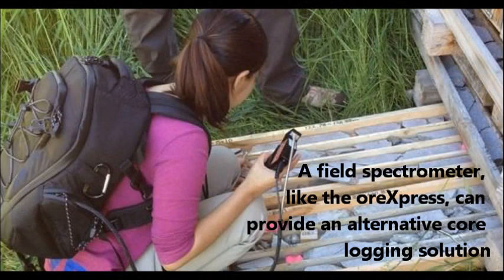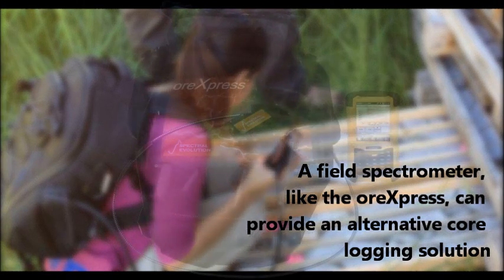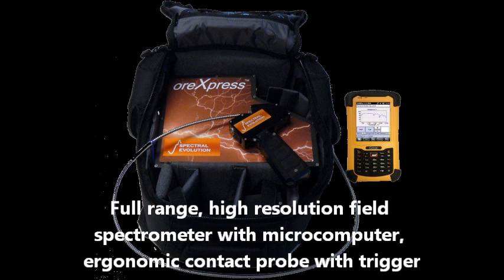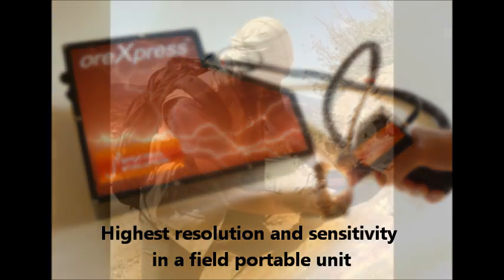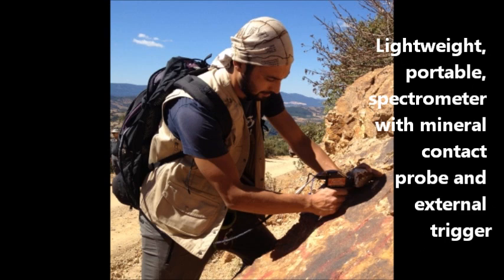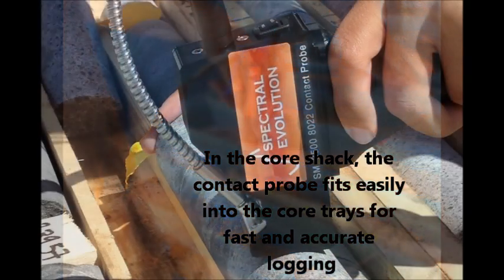The ORExpress is an affordable field spectrometer designed for mineral identification and analysis in the field. It is also exceptionally well-suited for the core shack. A full-range 350 to 2500 nanometer spectrometer, the ORExpress has the highest resolution and best sensitivity available in a field unit. The ergonomically designed mineral contact probe has an external trigger that makes scanning core fast and easy. The contact probe fits easily into the core tray or a chip tray, and incorporates a halogen light source.